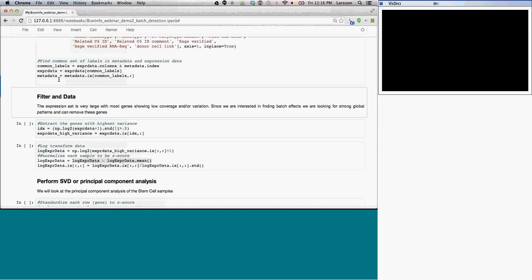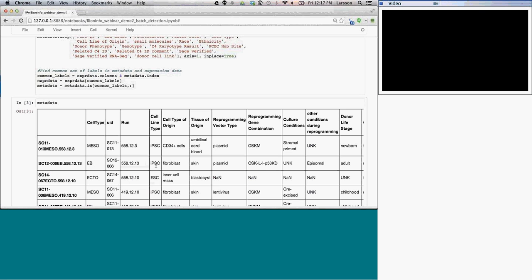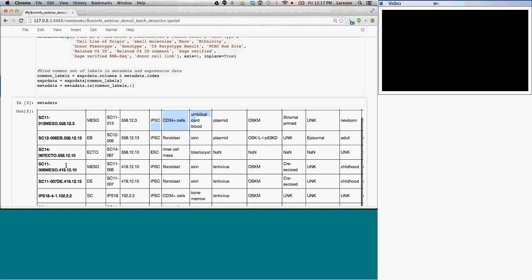Now, I'm going to add a line here just to make it a little bit easier, so you see what things look like. If I look at metadata, for example, we can see that metadata is a table. It has information about the cell lines, what they are, a UID, which identifies the canonical cell line. So this is the cell line differentiated into mesoderm. We can see where it derived from, and this is information such as the origin and how it was processed.